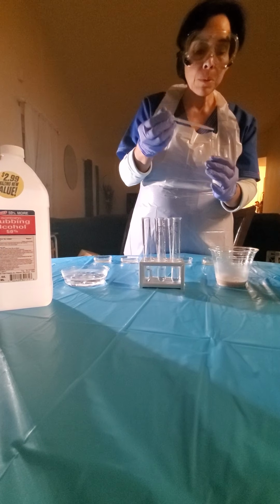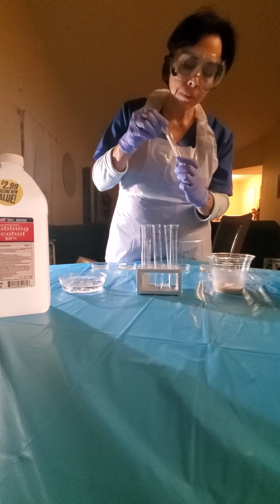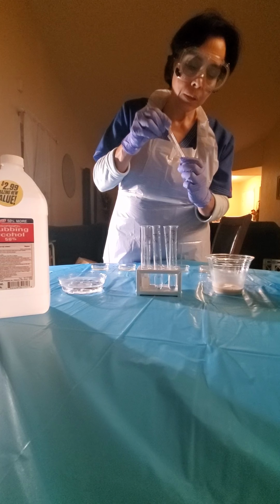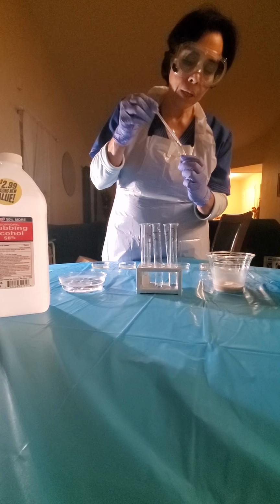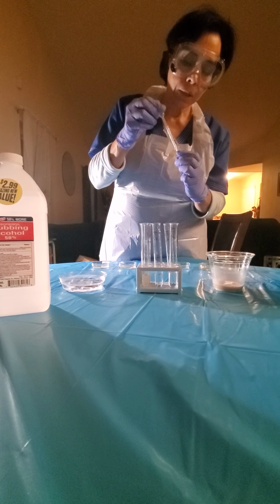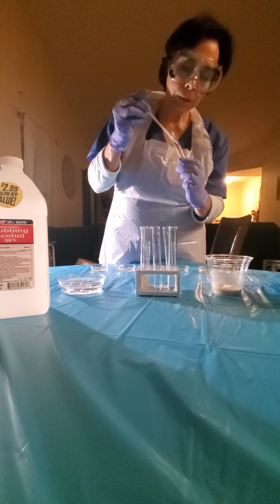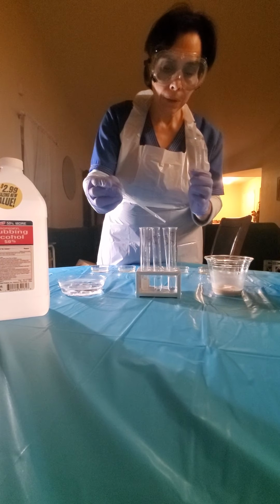So I'm gonna put 10^-1 back, and then from number 2, same process, take the 0.25 to number 3, and we put number 2 back.